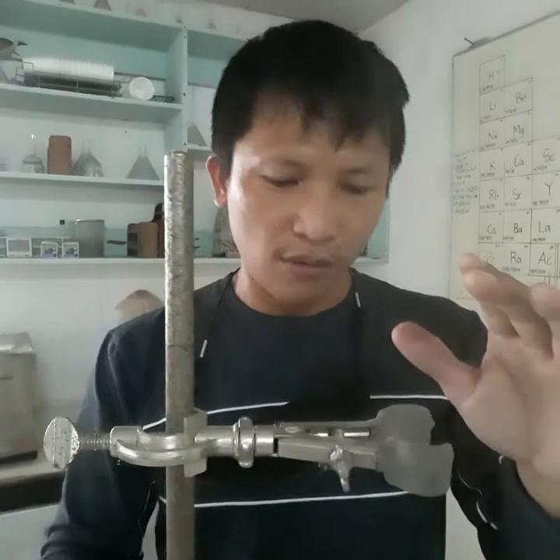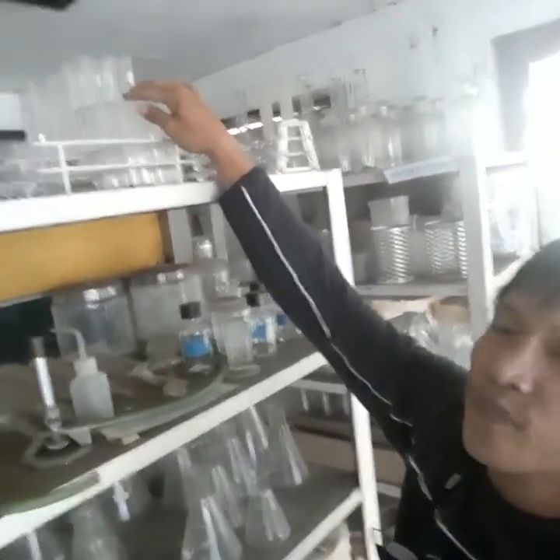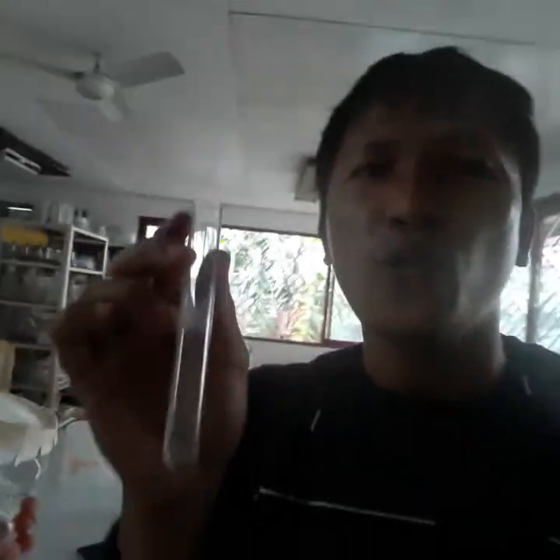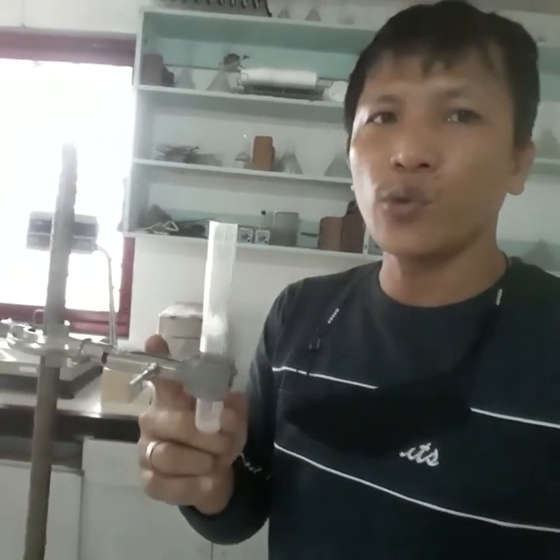Maybe the next item would be test tubes, so that the video goes smoothly. So you have here the different types of clamp holders for test tubes. So these are test tubes. Usually the clamp holder holds test tubes. You can see from the design of the clamp holder that you just have to mount it in this part. It's like that. As you can see, it's clearer. Then you have to screw the screw here. Maybe I can focus. So that's the setup for your test tube and your clamp holder.